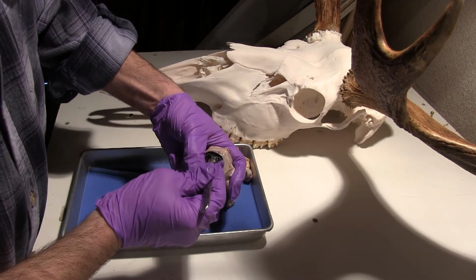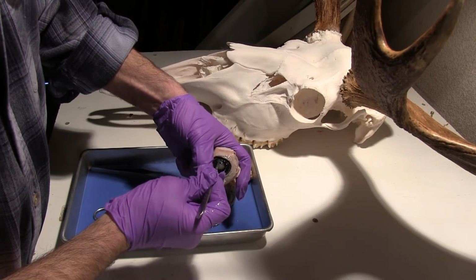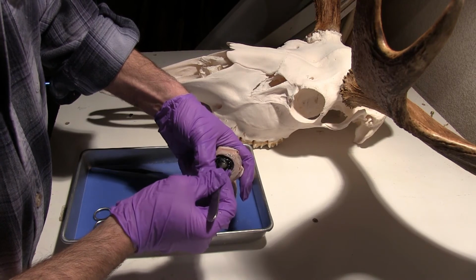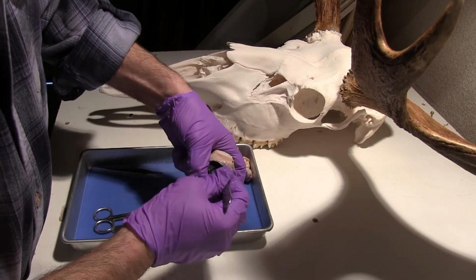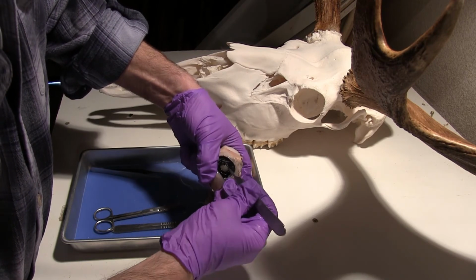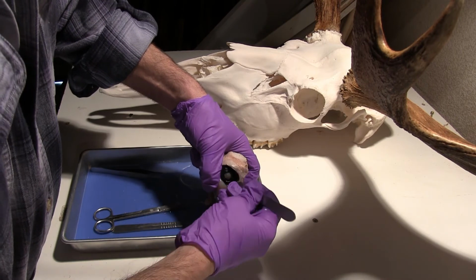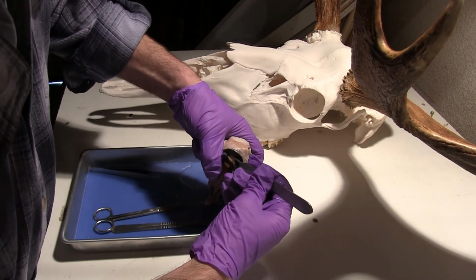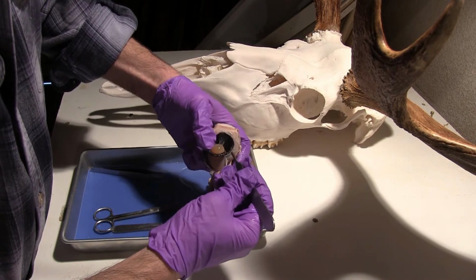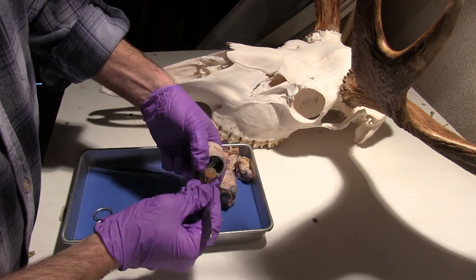Now this is of course how we're going to control how much light is getting into the eye. So that ciliary body is going to move to allow light to get into the lens. Now if I just remove the ciliary body from there, right there I can see the lens. And then in this posterior portion, that's the vitreous humor. So the lens is right there.